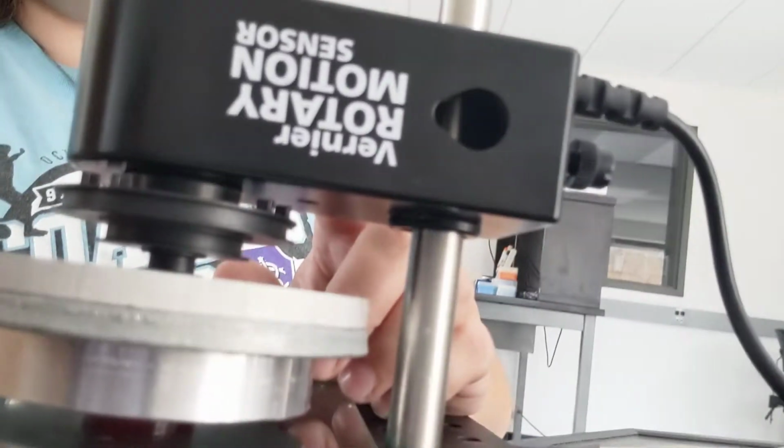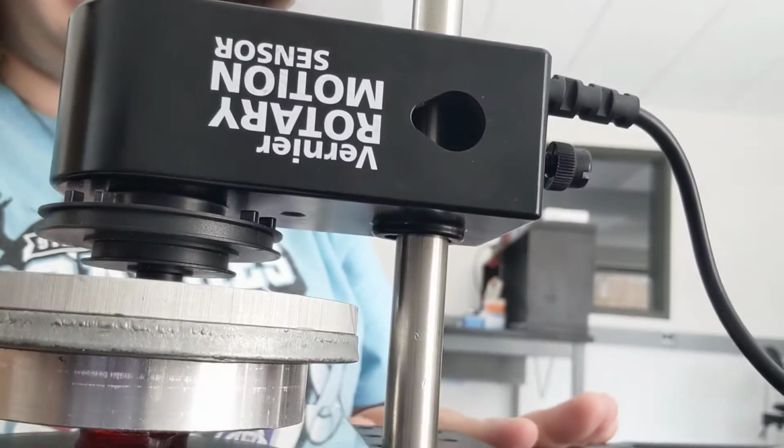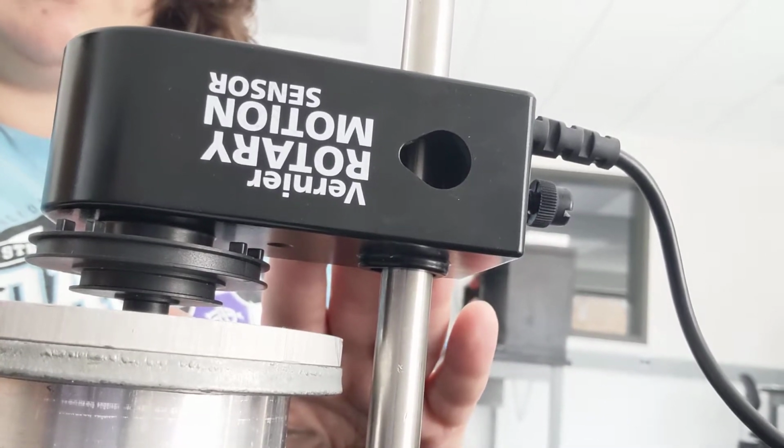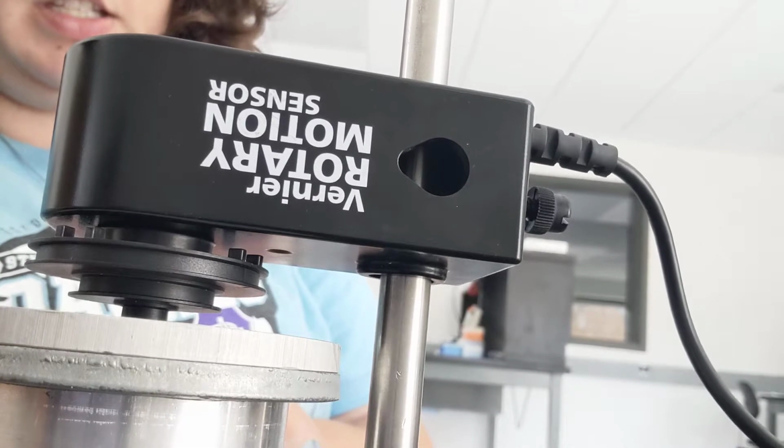We made it using a Vernier sensor called a rotary motion sensor. Now, the one that we have here is connected to a LabQuest, but Vernier actually makes a wireless version of this that can hook directly into your computer or other device.